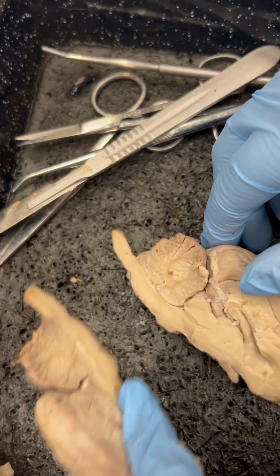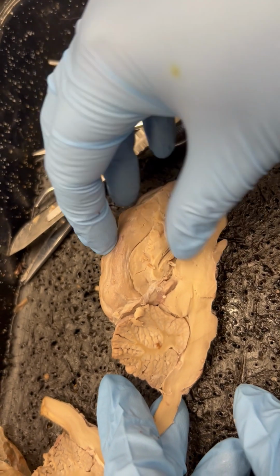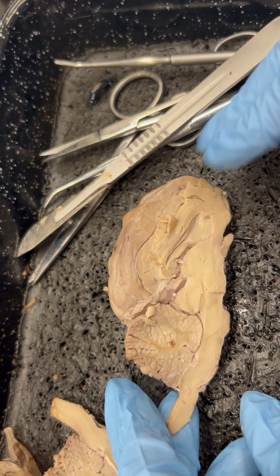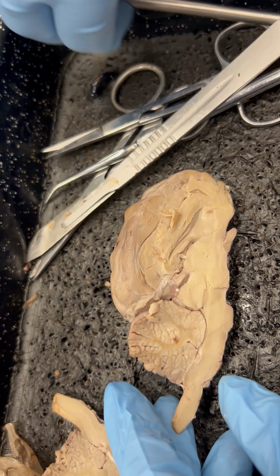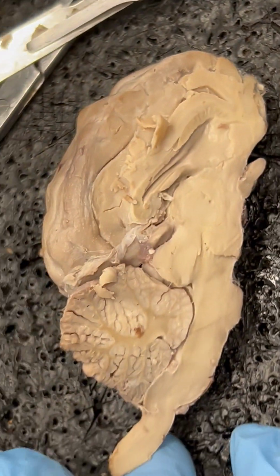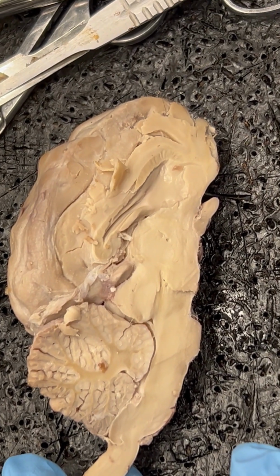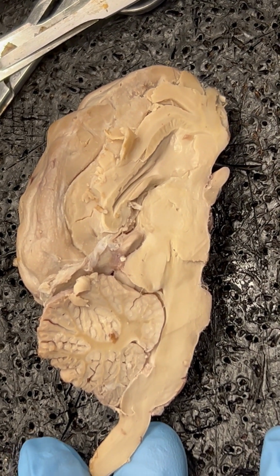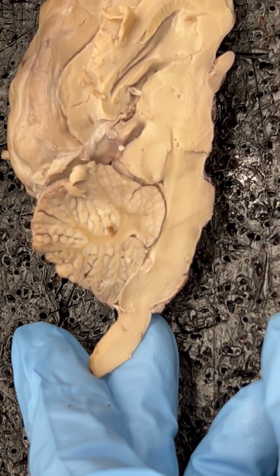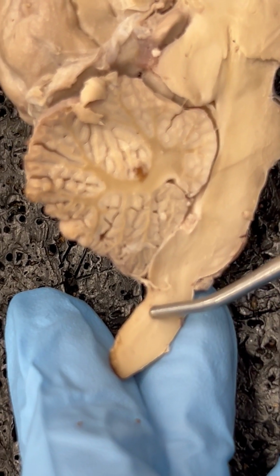For the one that I am going to use for the purpose of this video, I am going to choose to stay along the line of the same view that the textbook has. I think that will be easier for you guys when you're examining your specimens and watching the video in comparison to the lab manual. So we'll get started with number 1, which is the central canal of the spinal cord.